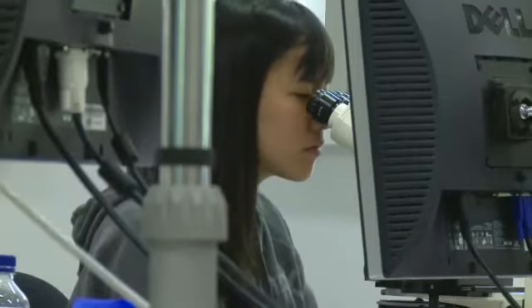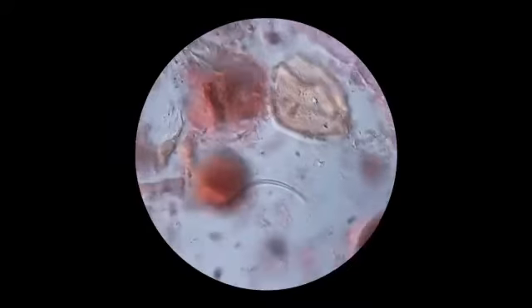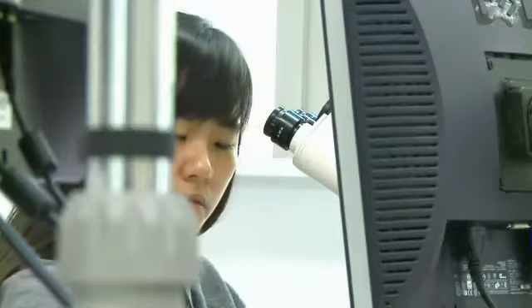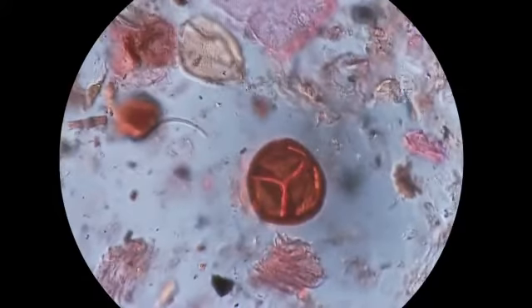There are lots of different types. Right now the process of analysing pollen is pretty much looking down a microscope at all the different grains. You can't look at all the grains, you have to look at a subsample. It's quite a painstaking approach. And a job no machine was smart enough to do, until now.